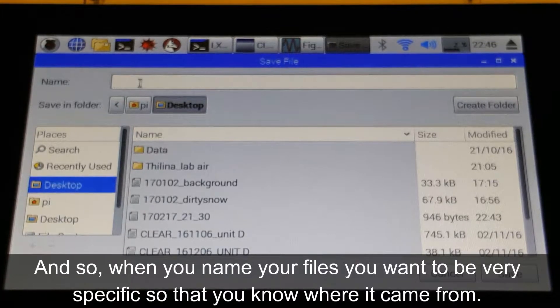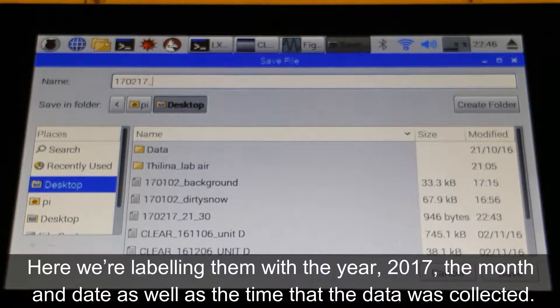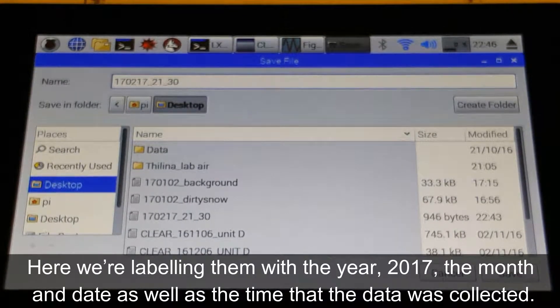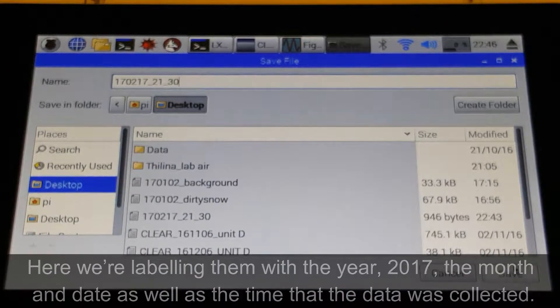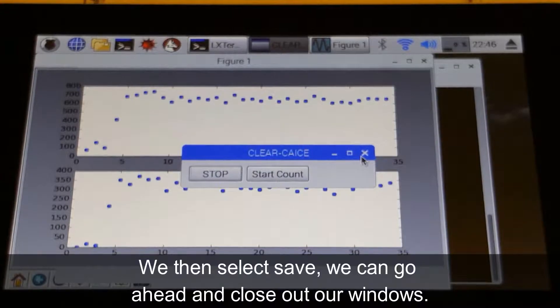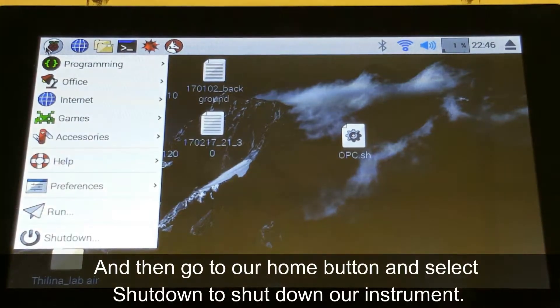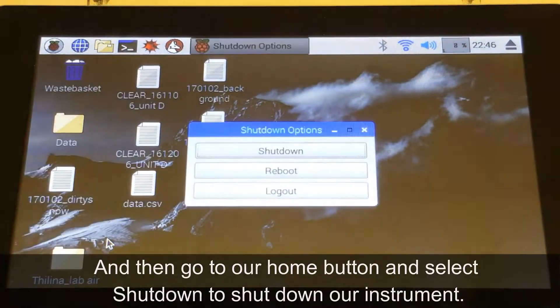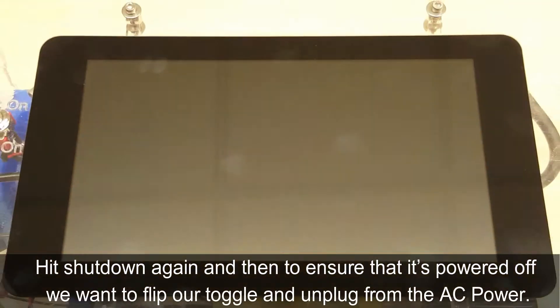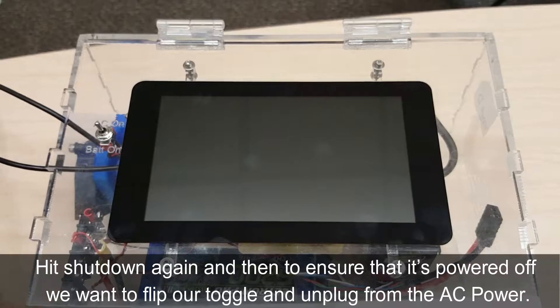When you name your files, you want to be very specific so that you know where it came from. Here, labeling them with the year 2017, the month and date, as well as the time that the data was collected. Then select save. We can go ahead and close out our windows, then go to our home button and select shut down to shut down the instrument. Hit shut down again, and then to ensure that it's powered off, we want to flip our toggle and unplug from the AC power.